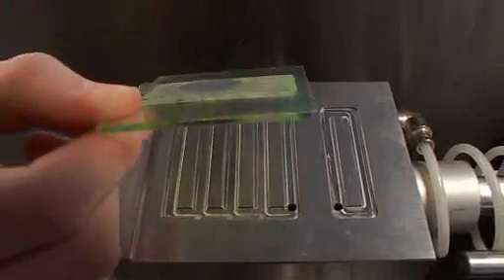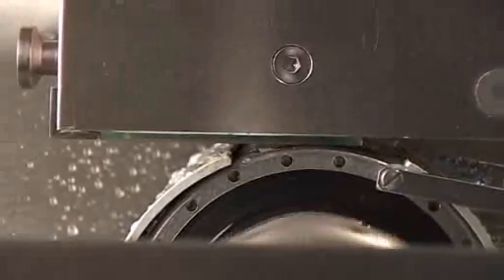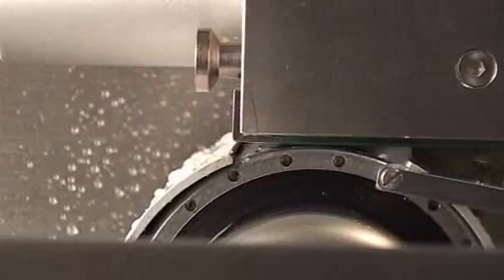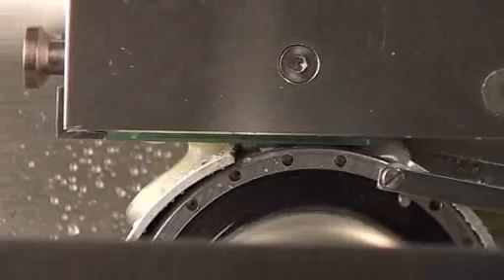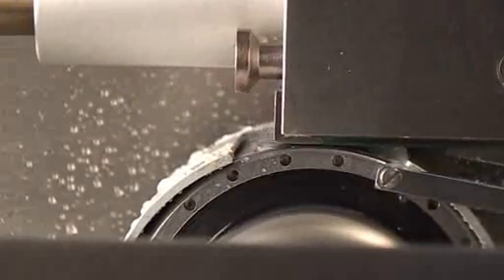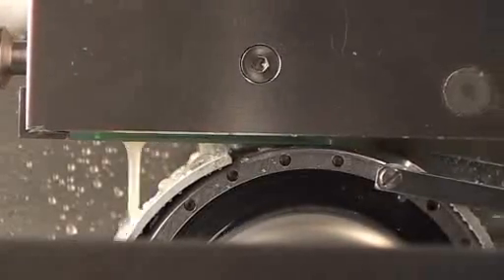For the final thin section, we use the wide microscope slide. The grinding stops when the sides of the glass touch the ball bearings. Once the grinding level has been established, no further adjustments are needed. This ensures uniform thin sections with the exact same thickness each time, regardless of the hardness of the material.